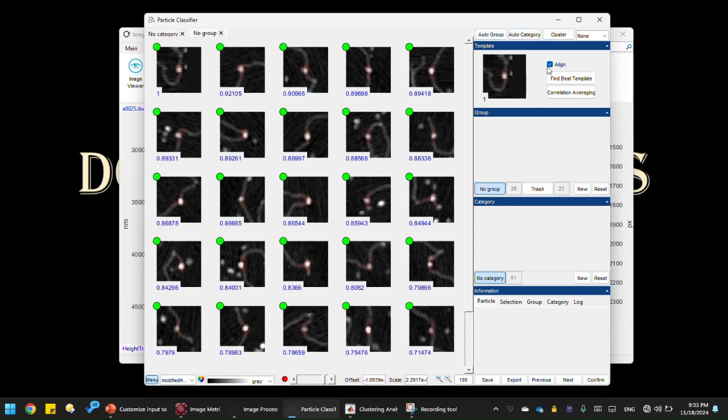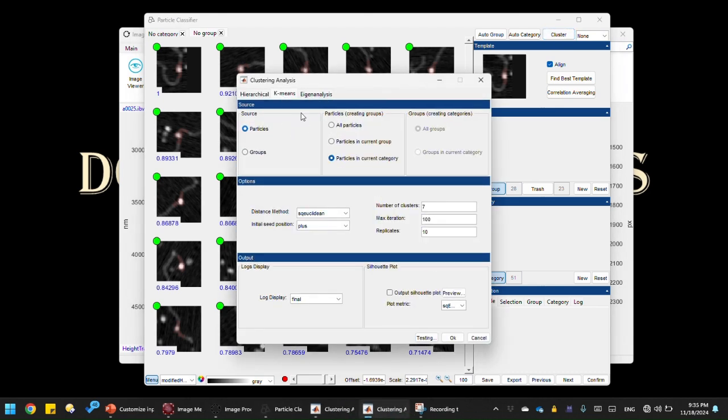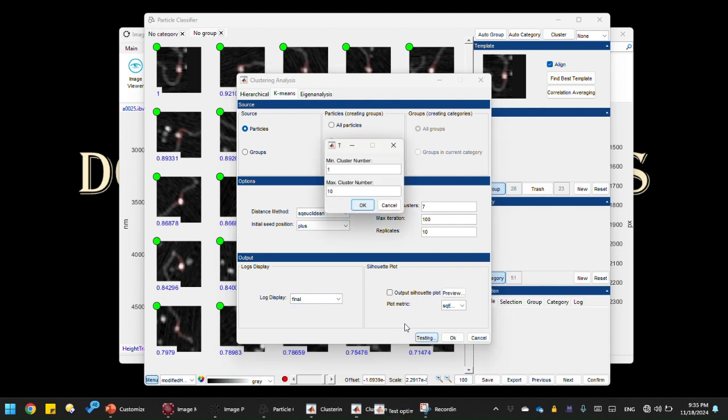Here I'm going to go through a clustering analysis and see what the issues are. So click cluster, and in this demo I'm going to use k-means because that's straightforward to understand. You simply specify how many groups or categories, here we just call them clusters, that you want for your final outcome. And determining the optimum number of clusters is essentially a guess, right? I can use testing, so I can sweep across these two parameters, a range of the minimum number and the maximum cluster number.